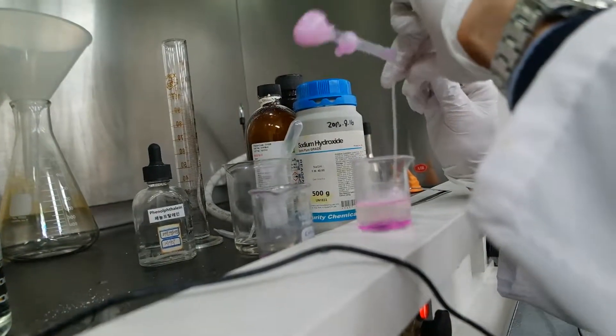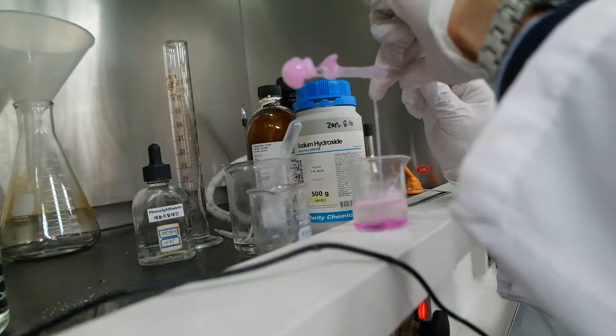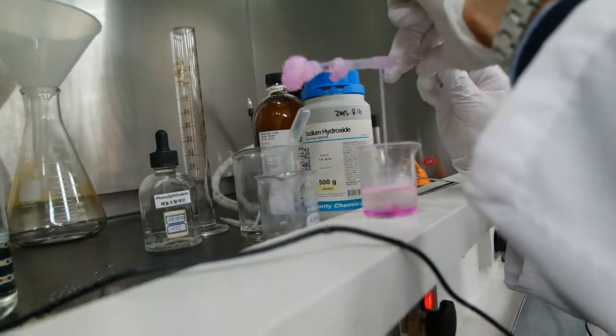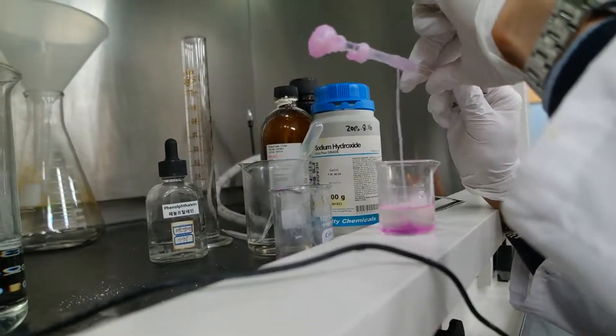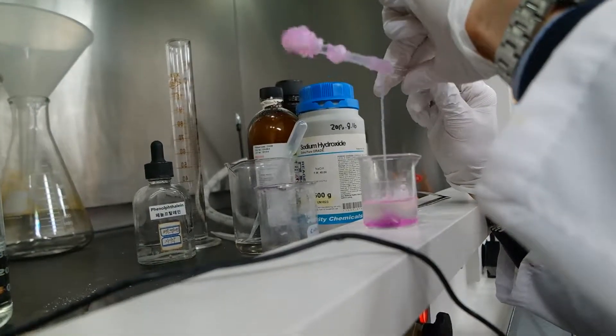So guys, we should mix it the opposite way, as in put the white stuff in the pink stuff. Okay. That's so descriptive. I know, right? But yeah, everyone should understand that.